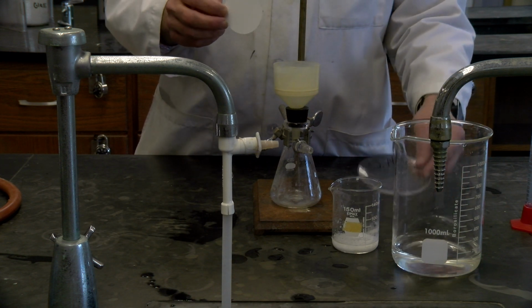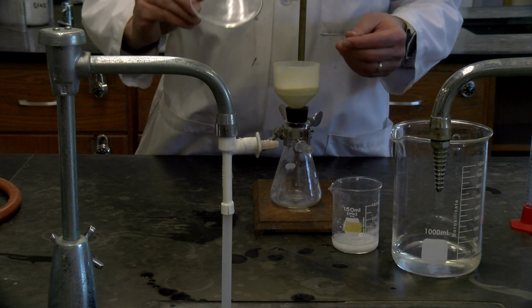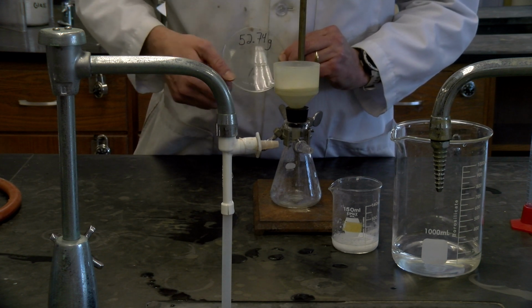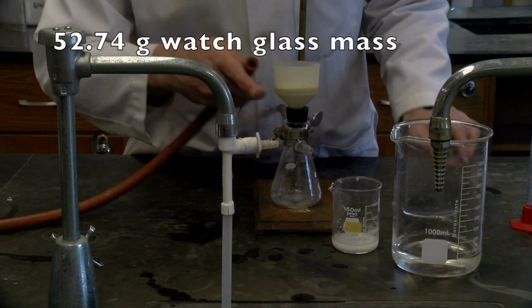One little change is that the procedure talked about weighing the filter paper and air drying it. What I'm going to do is, since I'm going to oven dry it, I'm going to change that slightly, and I've weighed the watch glass, and so the watch glass weighs 52.74 grams, and so I'll eventually put the solid right on here to dry. All right, so just note that, and I'll show you a little bit more of that in just a second.